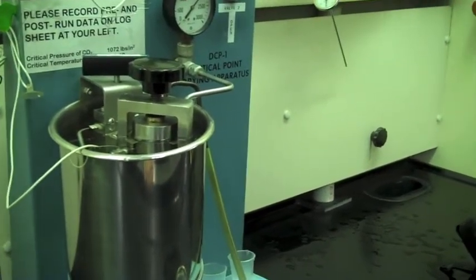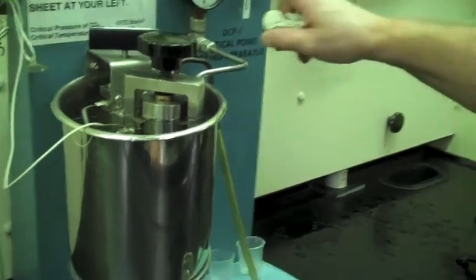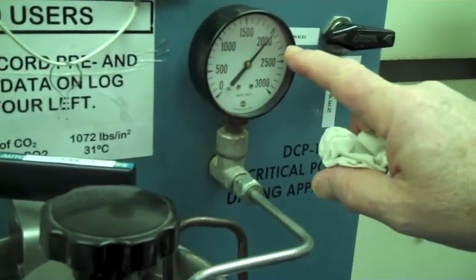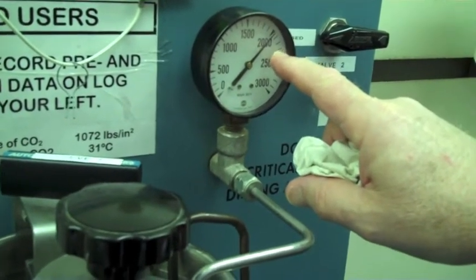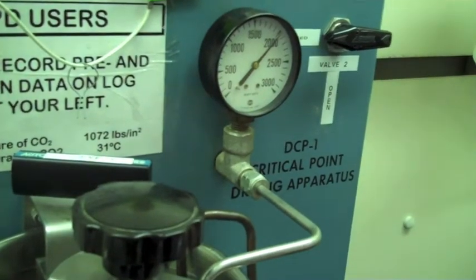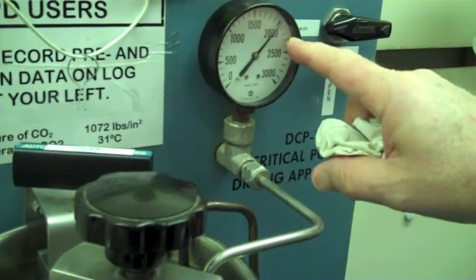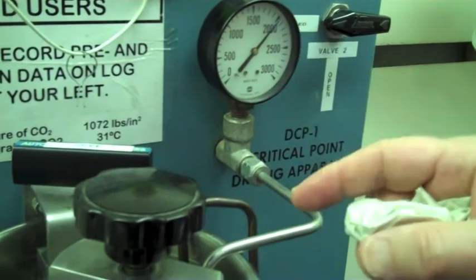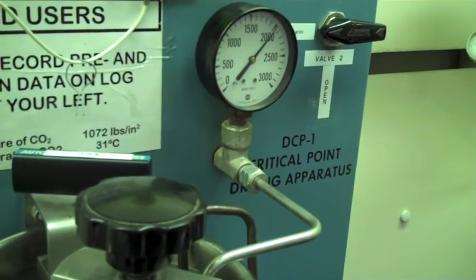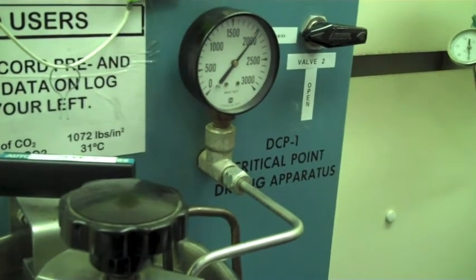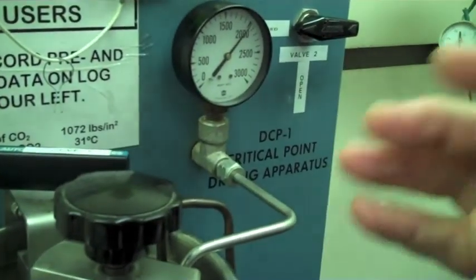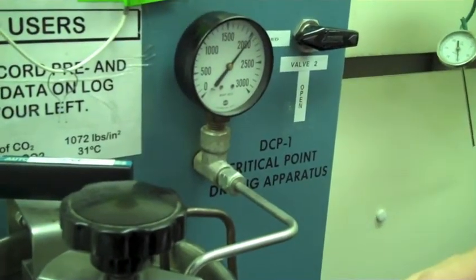So tell me again, what are you looking for here again? Well, I'm sort of balancing out the rise in pressure with a leak rate. When the pressure starts going down naturally, I know it's close to that stabilized point. Then I'll close the valve and see if it still rises. If it still rises, I'll have to bleed a little bit more.